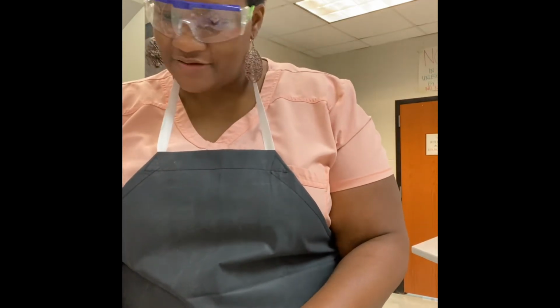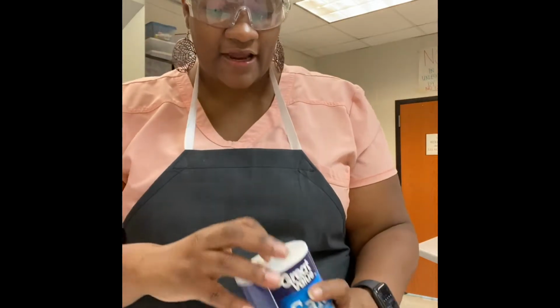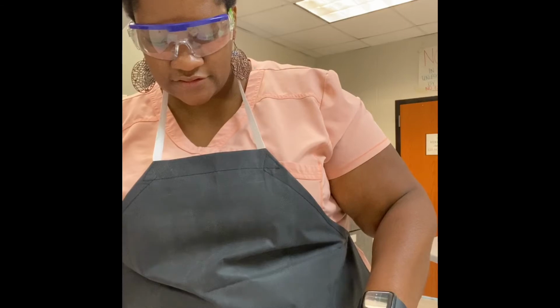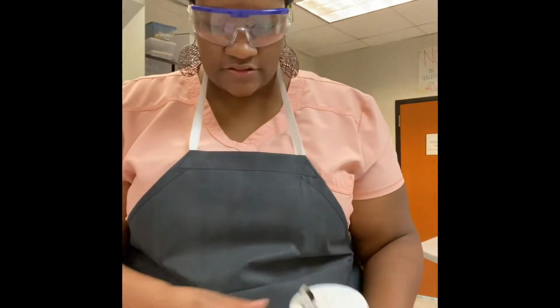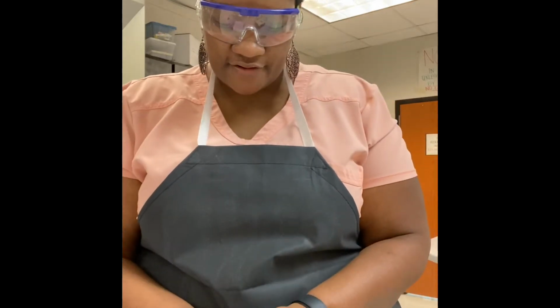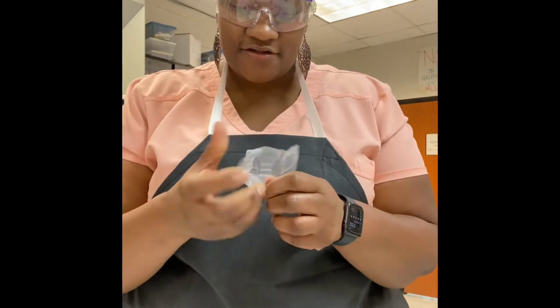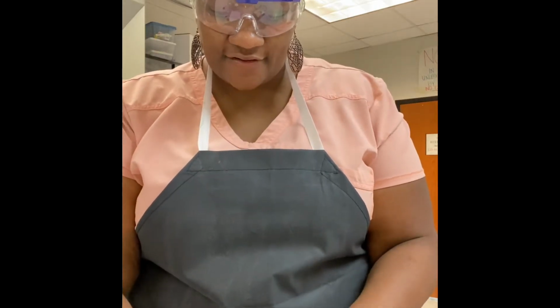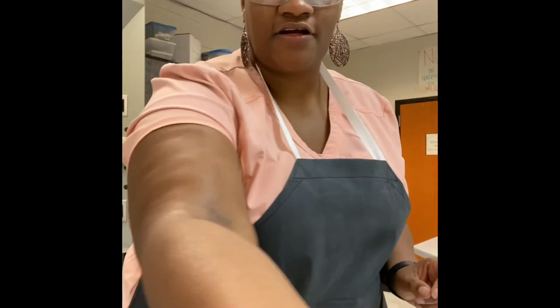I'm looking at my hot plate and I'm hoping the one that I got is big enough for this. I have my salt. And then I gotta take the paraffin off the paper. I stretch it just a little bit. Okay, and then I'm gonna put that on here. All right, these things are gonna go on the hot plate for 5 minutes. So let's get started.